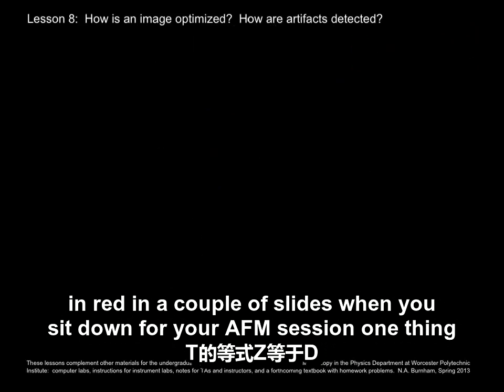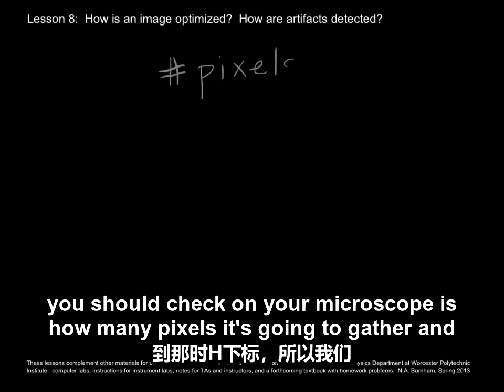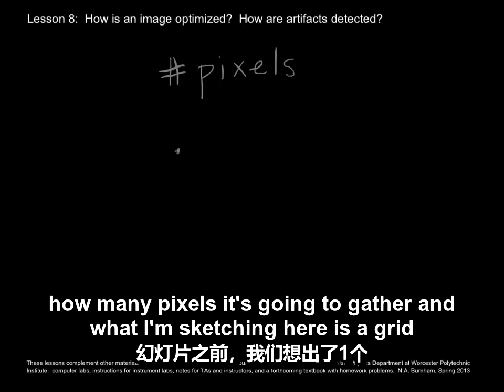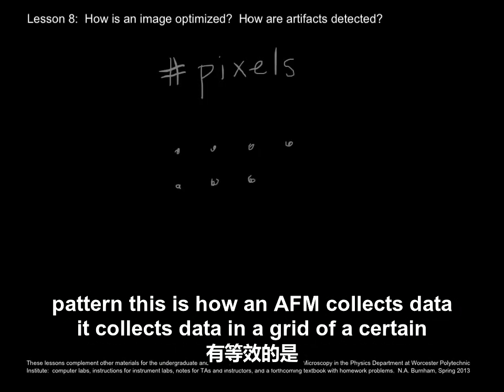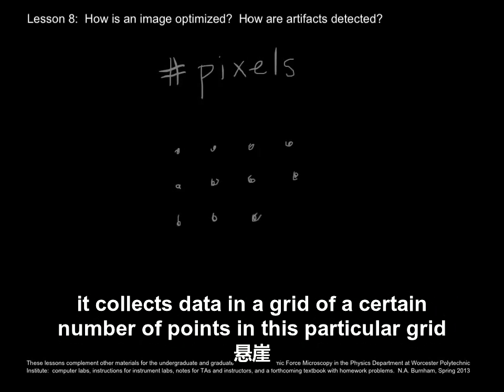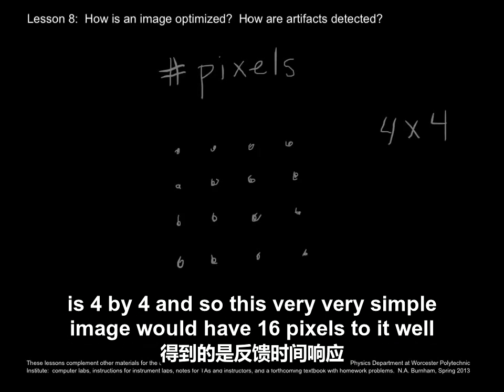When you sit down for your AFM session, one thing you should check on your microscope is how many pixels it's going to gather. And what I'm sketching here is a grid pattern. This is how an AFM collects data. It collects data in a grid of a certain number of points. This particular grid is 4 by 4, and so this very, very simple image would have 16 pixels to it.